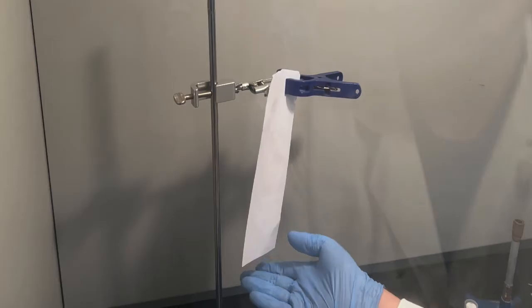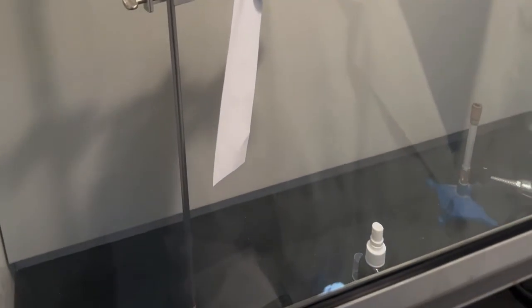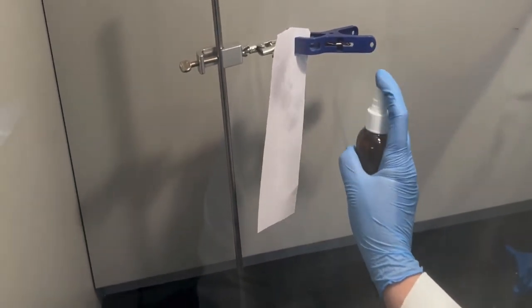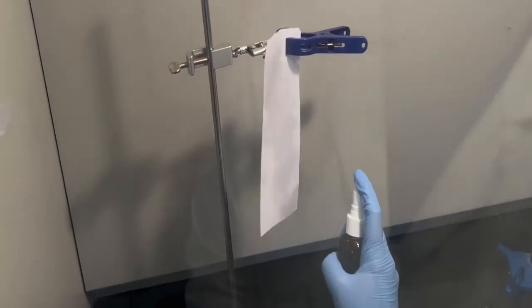To develop prints with chemicals, first place the prints in a well ventilated area such as a fume hood. Obtain the chemical developer in a spray bottle, ninhydrin in this case, and apply the solution 2-3 inches away from the surface. Allow the prints to air dry for 2-3 minutes. Left alone after treatment, ninhydrin can take up to 10 days to develop latent prints.